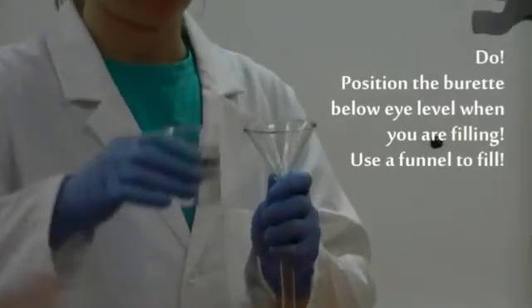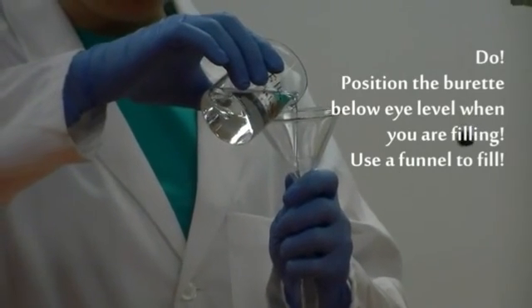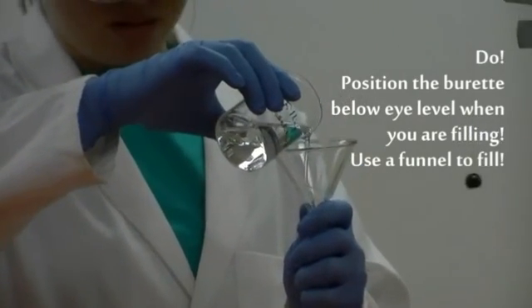And ensure that the tip of the burette is rinsed out. So position the burette below or at eye level and use a funnel.